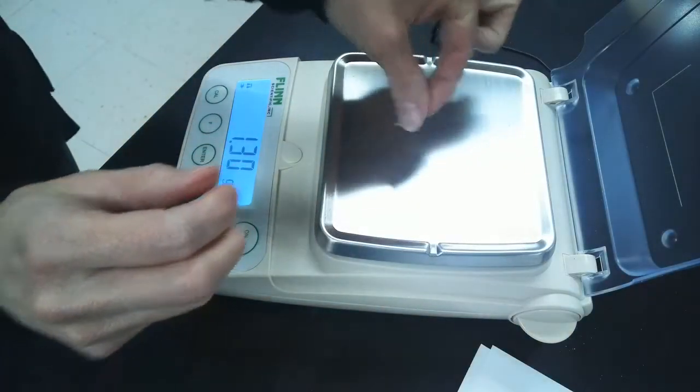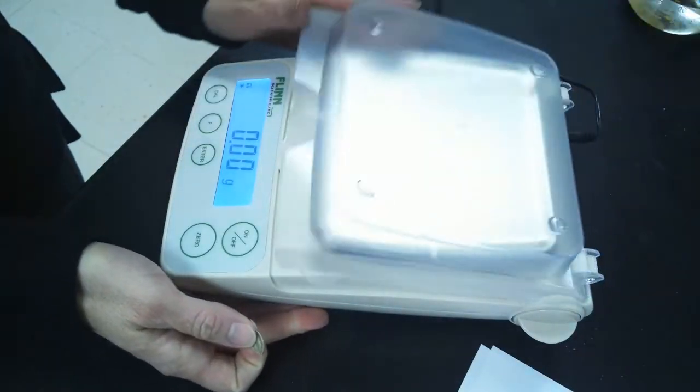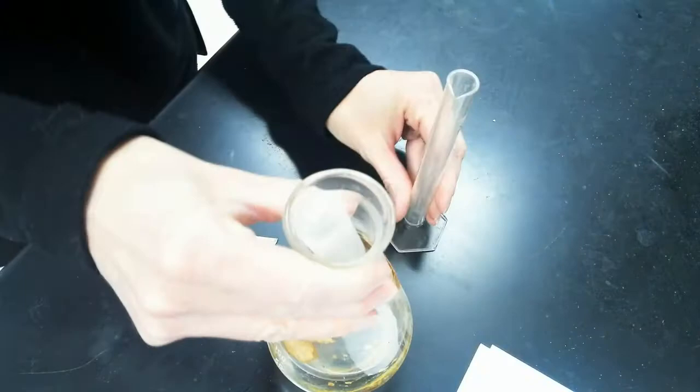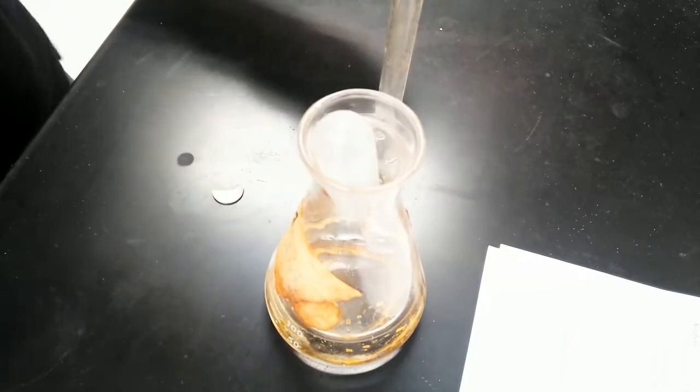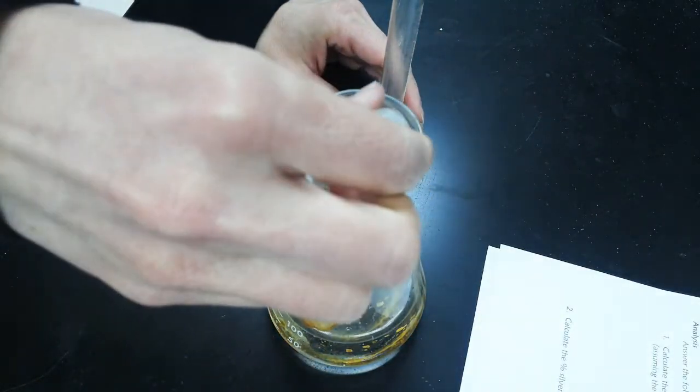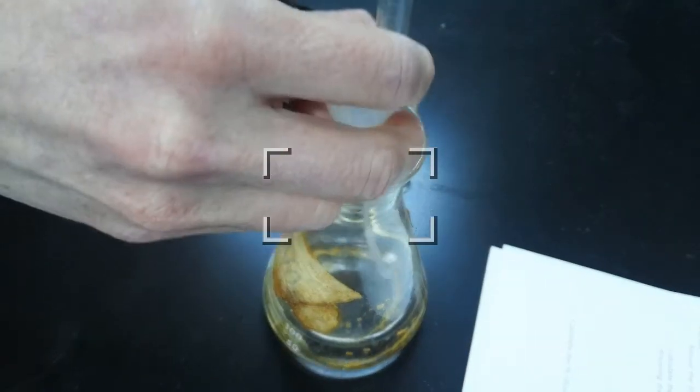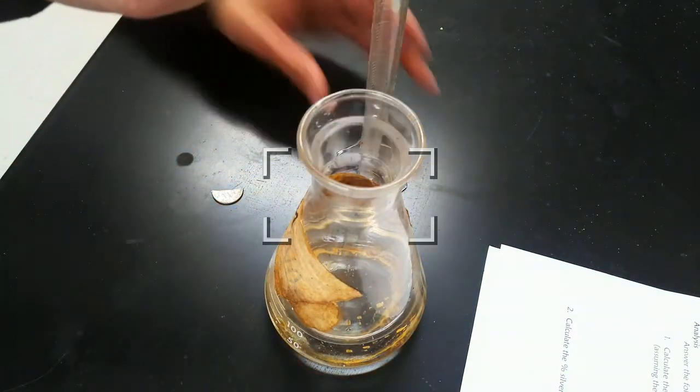Okay, so that's taken care of. Then the only other thing we need to do is put it in a little bath of nitric acid for a day or so. We're gonna use about 10 milliliters of nitric acid and it'll be relatively concentrated. This is about six molar. I would choose not to drink this, ingest this in any way.